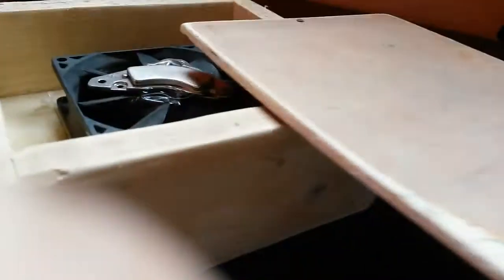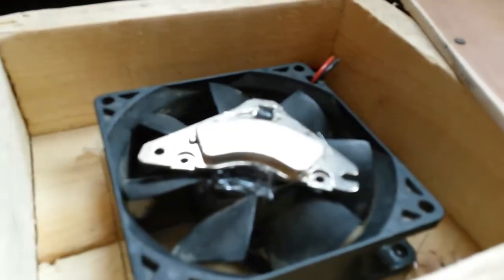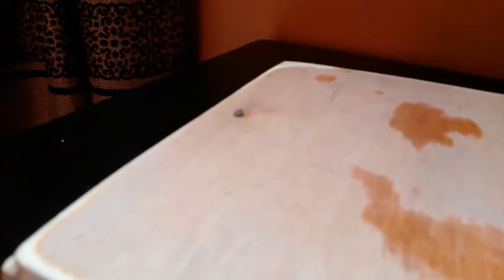The cover is made up of a sheet of plywood and it's secured with two nails — one over here and one over here. One of the nails is removable to give you access to the CPU fan to service it. The second nail is then hammered into place and as a result the cover is fixed.